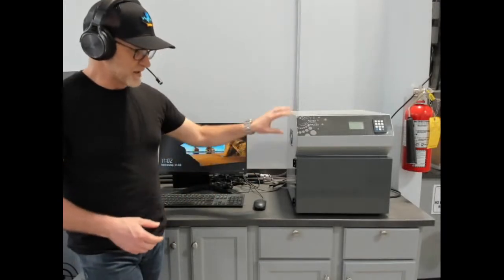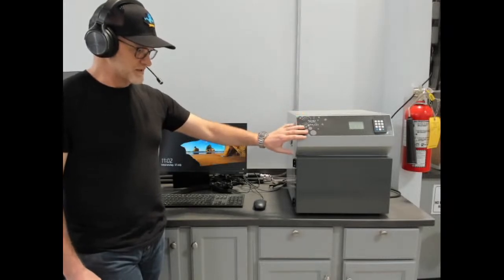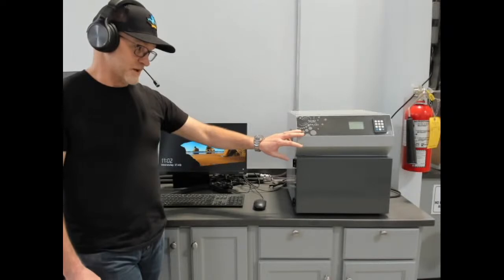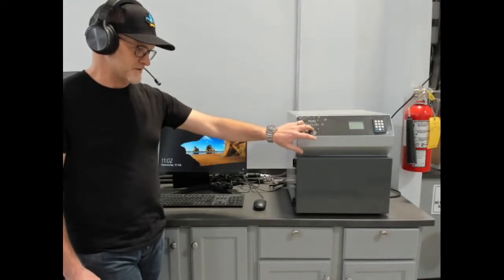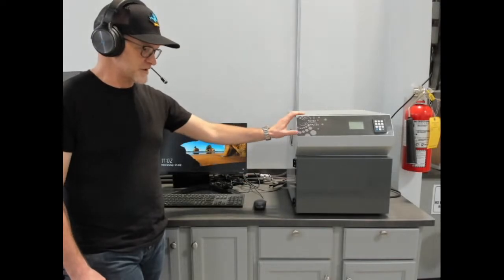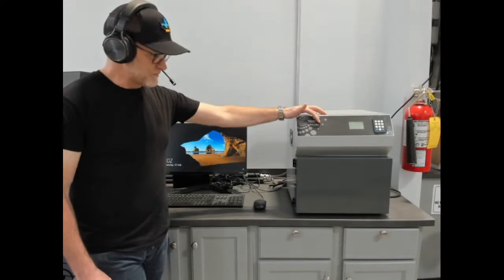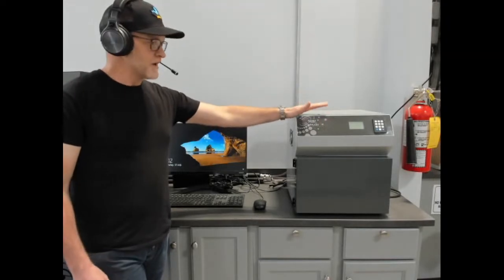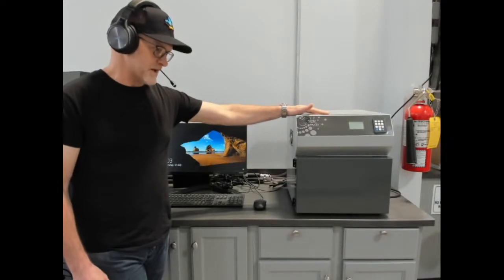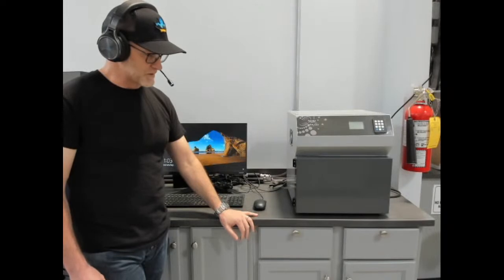The inside space is 12 by 12 inches or 300 millimeters square. And the HFM 100 has a plate temperature range of -20 to 75 Celsius. There is a high temperature version of this that is -30 to 110 Celsius, and that's called HFM HT, high temperature. The accessories you can add to this are specific heat measurement and a high TC kit for measuring up to 2.5 watts per meter Kelvin.